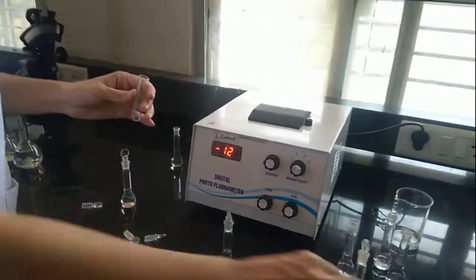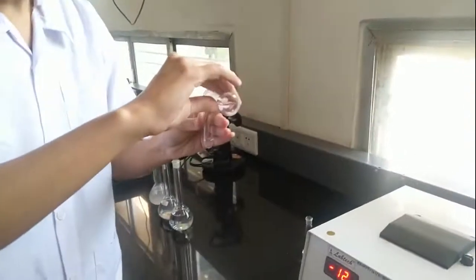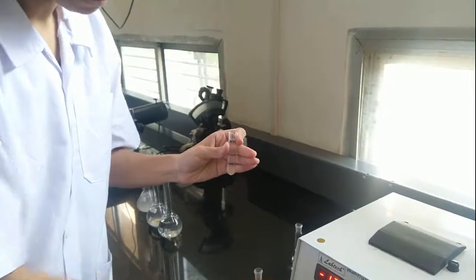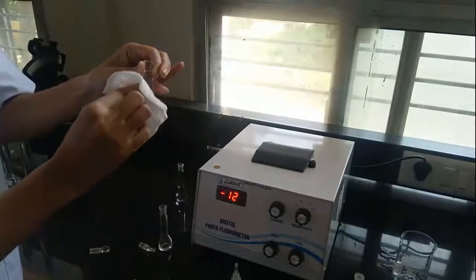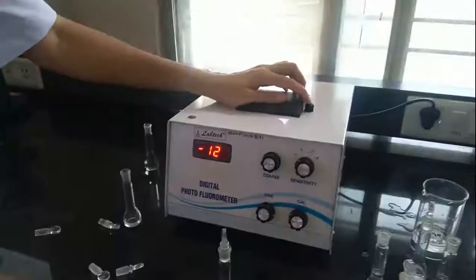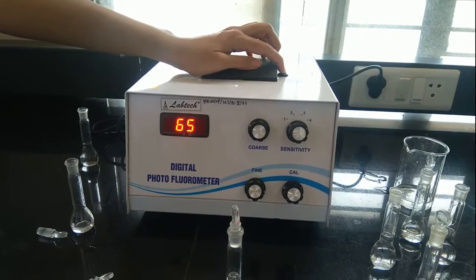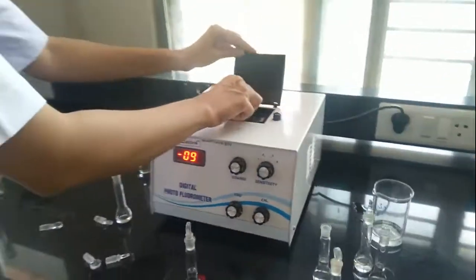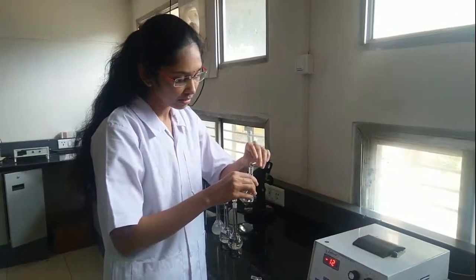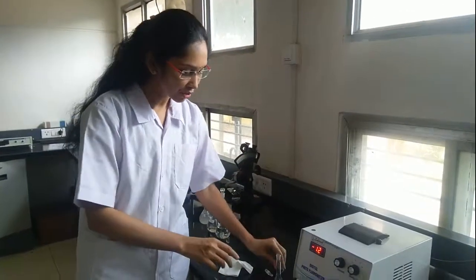We had already set 100 with the highest concentration. Now we are going to take the reading of the unknown — this is our unknown concentration of quinine sulfate. Press the button. The reading is 65, so note down this reading. Now we have taken the reading of the unknown. We are going to put this value into the graph obtained by plotting the readings of our standard solutions, and from the graph by extrapolation we are going to find the concentration of our unknown solution.